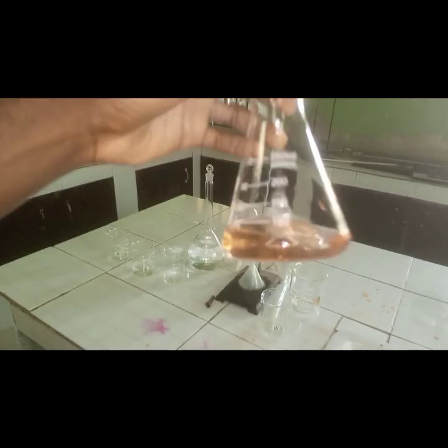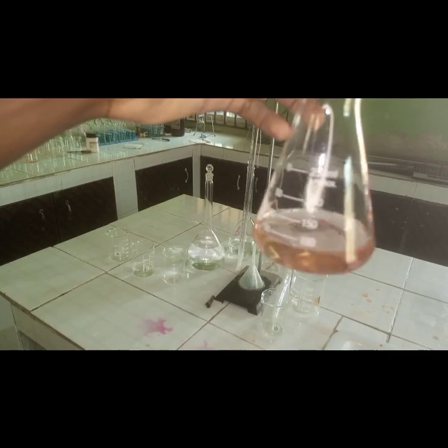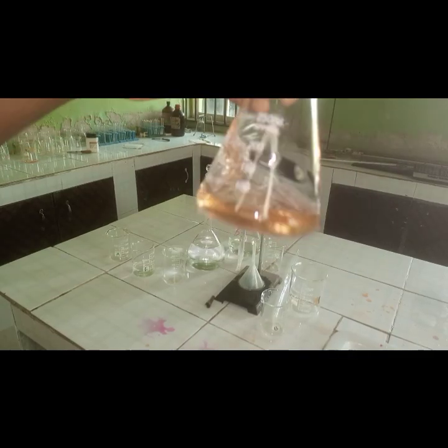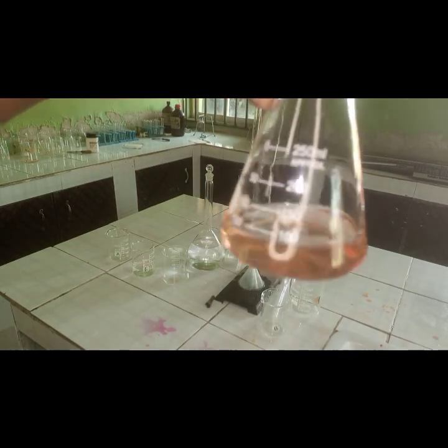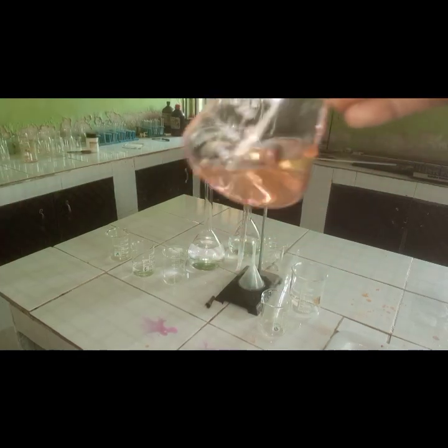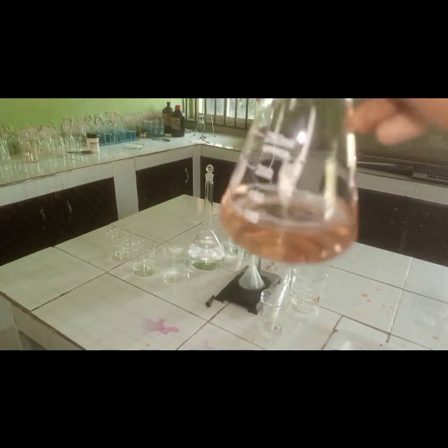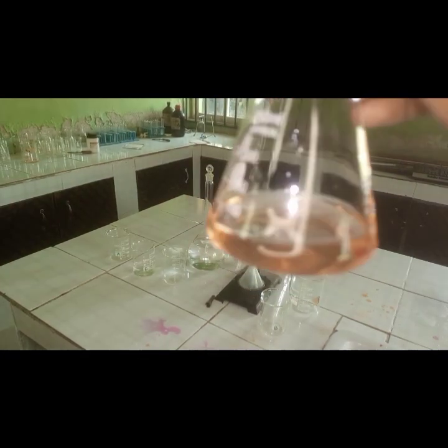So at the end of the first titration, this is what we got. So this is actually the color changes to something pink. So this is what we got. So that's the end point. So we mark our first reading.